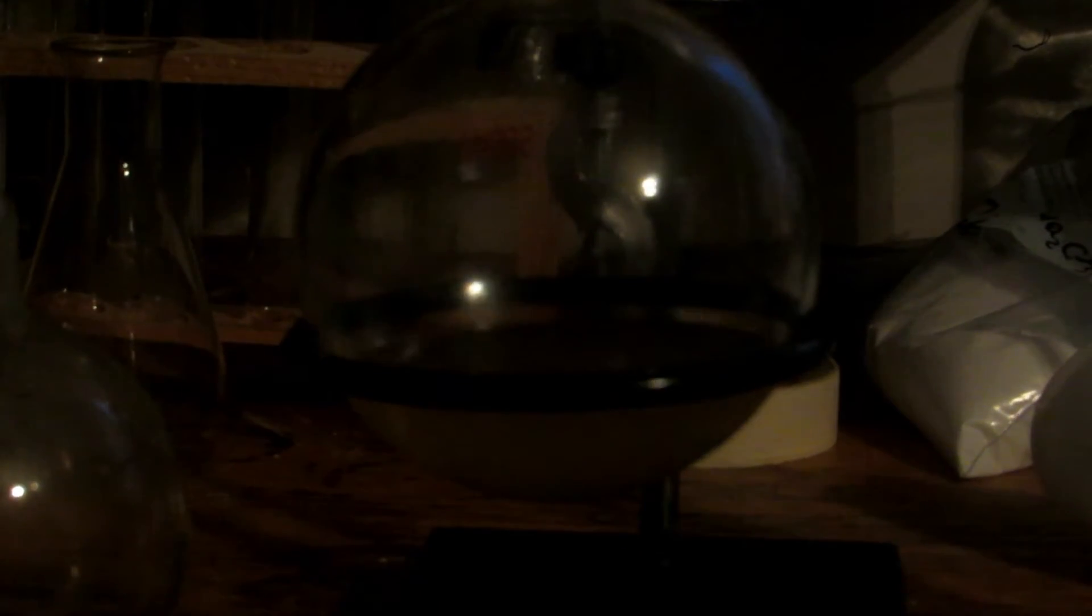We're back inside and I've placed it back on the ring stand. There's a little bubble at the bottom of our wintergreen oil. This is still a bit warm from gently heating and evaporating off most of the methanol.